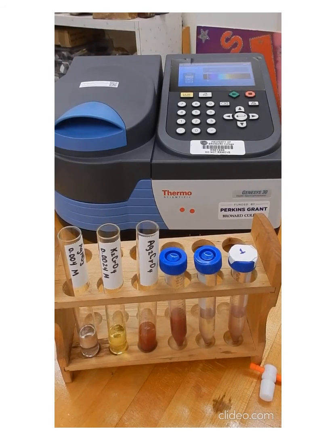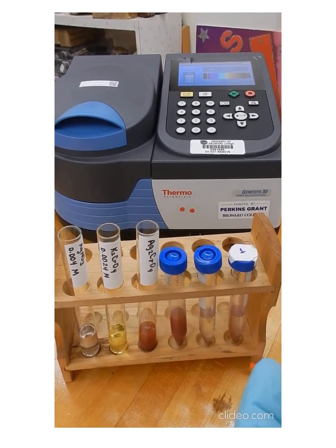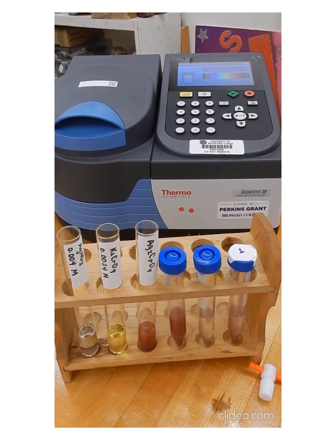So that absorbance corresponds to the chromate ion that is actually in solution, that is in solution because the silver chromate is dissolving to give you that amount of chromate ions in solution. That absorbance is the absorbance that we're using in the graph to get the concentration of the chromate ion. So you're finding that absorbance on your y-axis, you're moving to the line that you have for your graph, and from your line you're moving down to approximate the concentration of your chromate ion in solution.